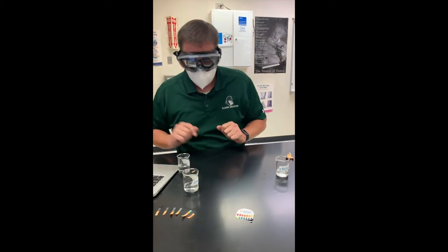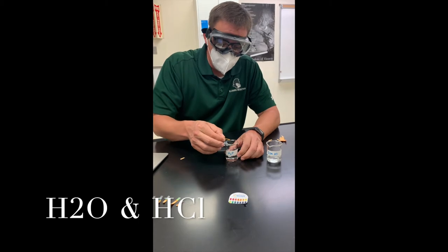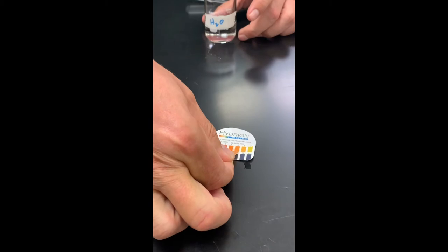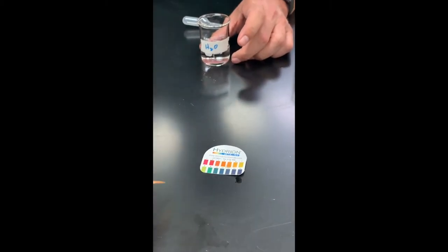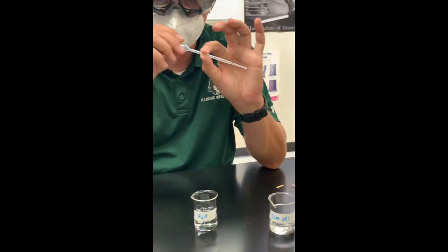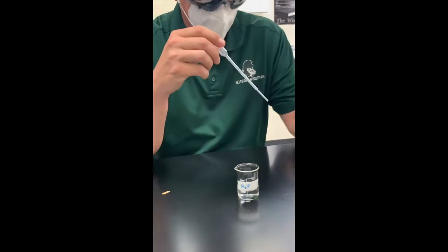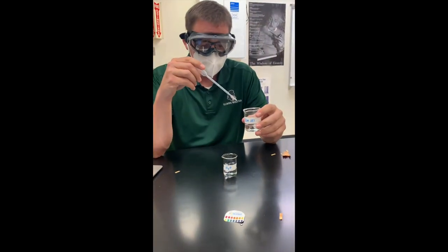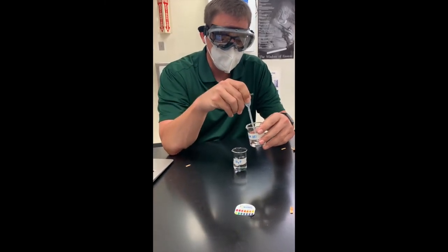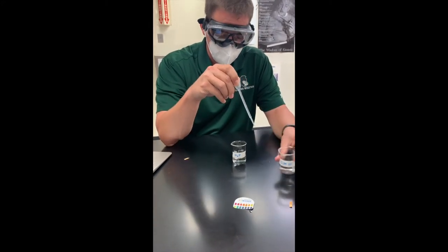We'll put that to the side. We've got three more tests, so this is our second test. We've got pure distilled water again from our container that's been sitting open, so it's become acidified a little bit. Again the pH just seems to be sitting right around a five for our pure water. This time we are going to test the effects of adding hydrochloric acid to the pH of our water and see how quickly it changes. We're going to add one milliliter of 0.1 molar hydrochloric acid at a time.